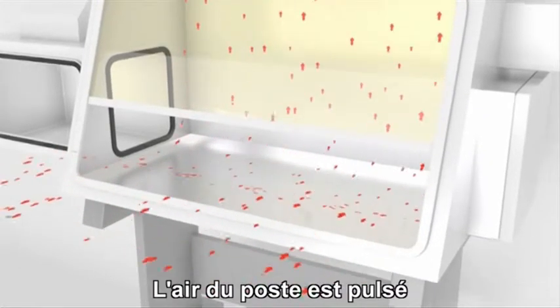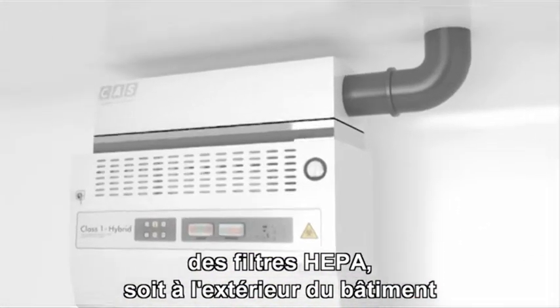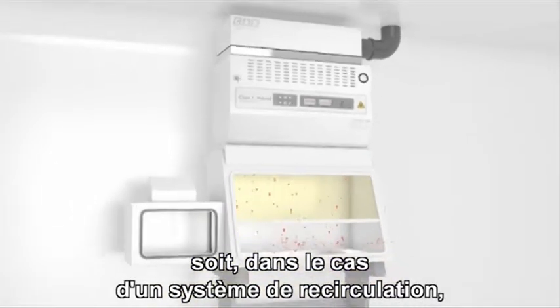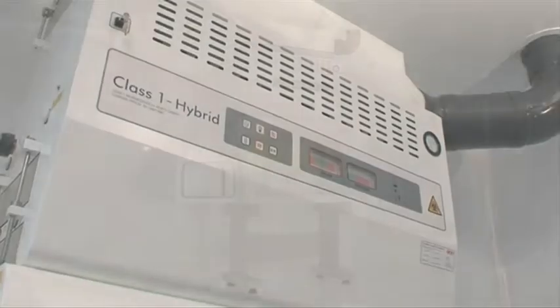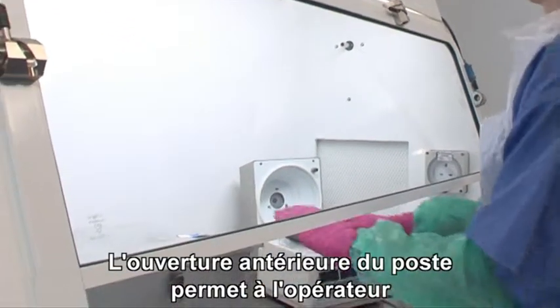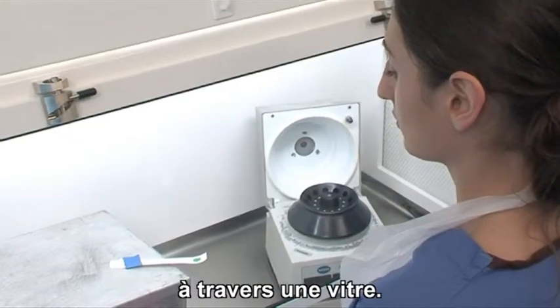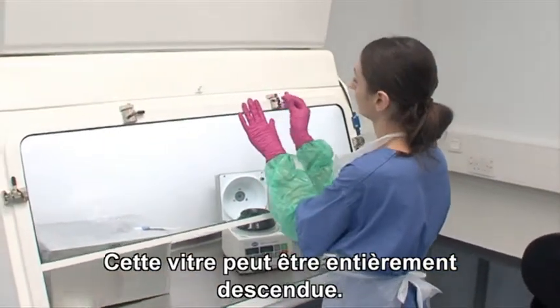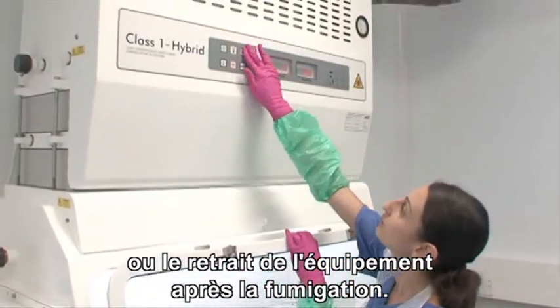The air from the cabinet is exhausted through double high-efficiency particulate air filters, HEPA filters, either to the outside of the building through the building exhaust system or, in the case of a recirculating type, back into the laboratory airspace. The front opening of the cabinet allows the operator to reach the work surface inside and observe what they're doing through a glass panel. This panel can be fully lowered. It should only be opened for cleaning, servicing or equipment removal following fumigation.